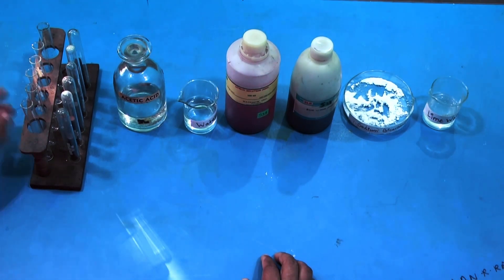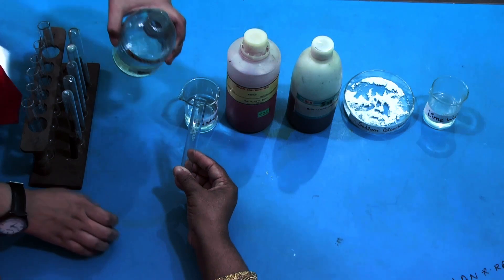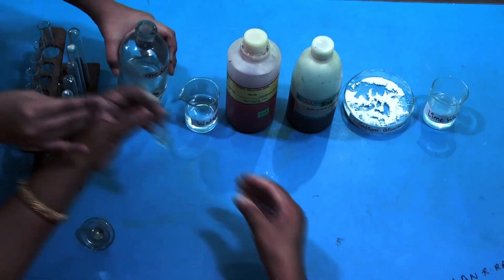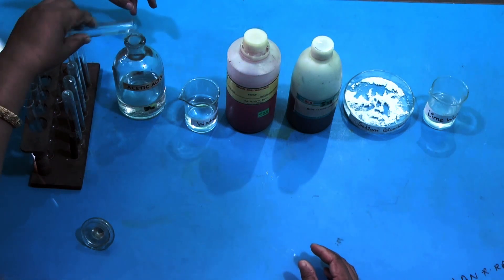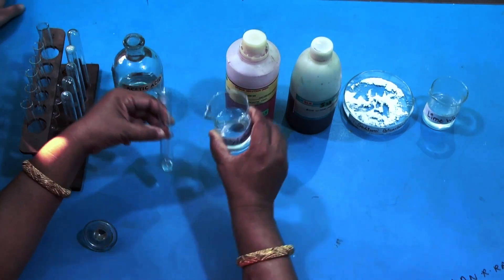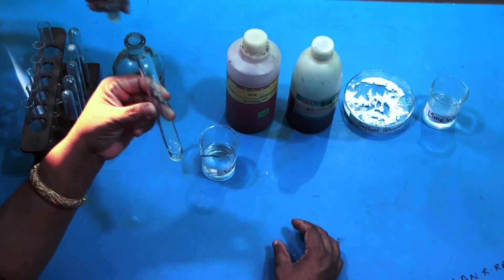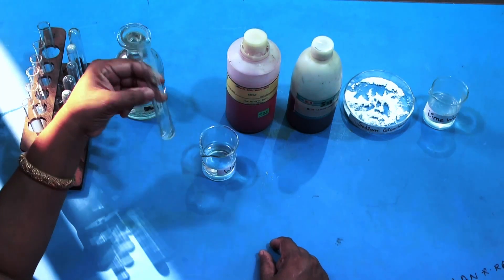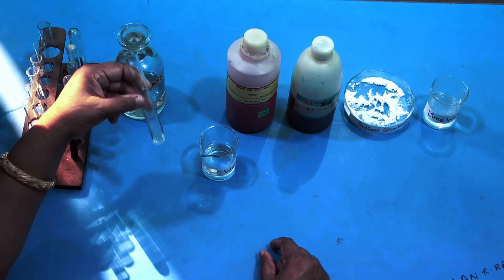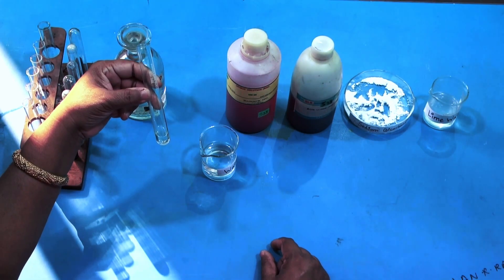First of all, we will take 2-3 ml of acetic acid in a test tube and observe whether the acetic acid is dissolving in water or not. We can see clearly the acetic acid has dissolved — it is not giving any two different layers or suspension. Clearly we can see it has dissolved.